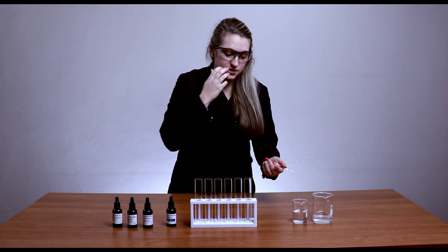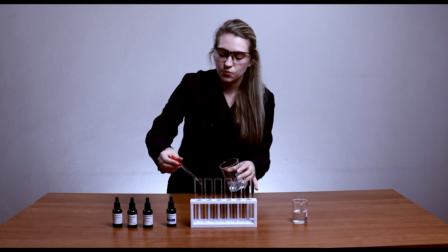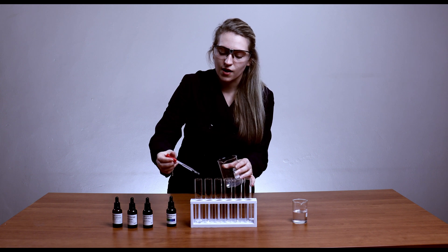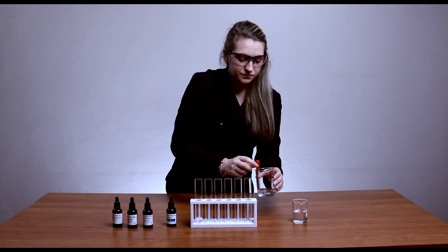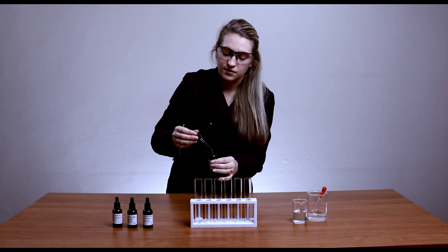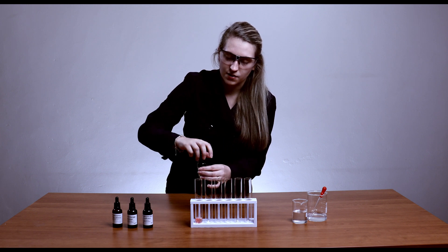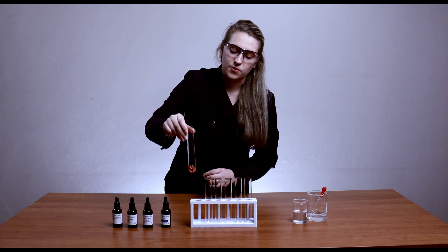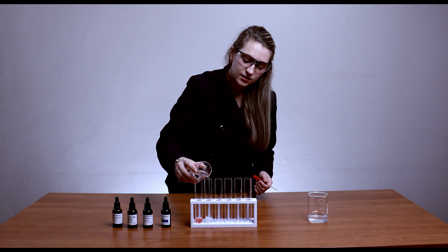If you have a very weak acid, you don't have complete ionization, which means that you don't have a lot of hydrogen ions or hydronium ions in your solution. I'm going to put my indicator in here and we expect to see a nice red color — not too red, probably going to be a little bit more pink. Adding two drops of my indicator, you can see that's definitely showing a very low pH.